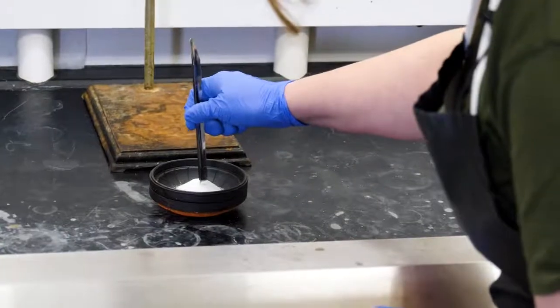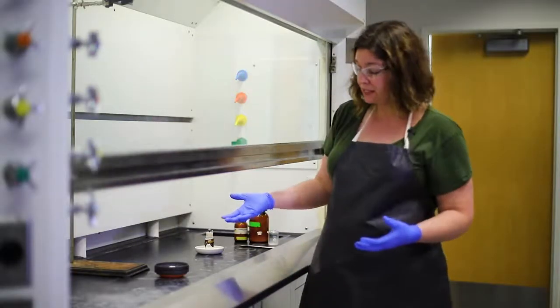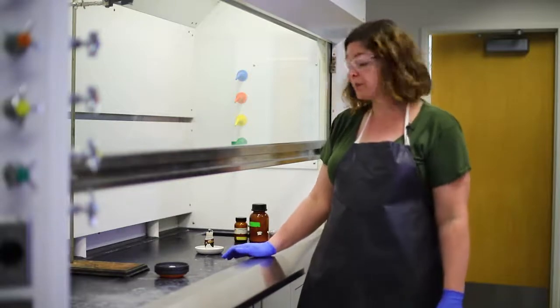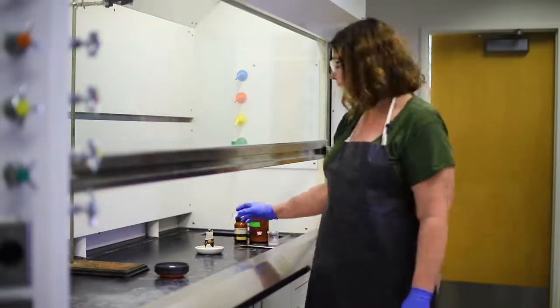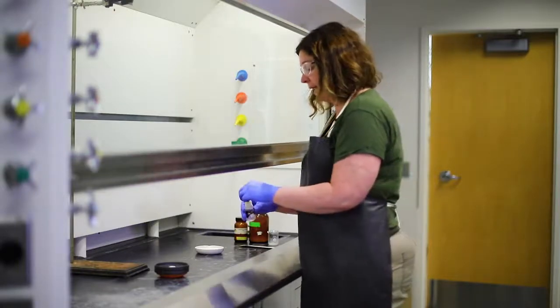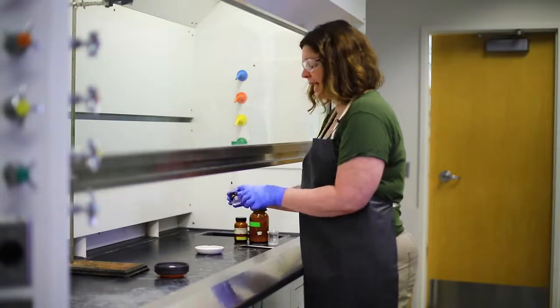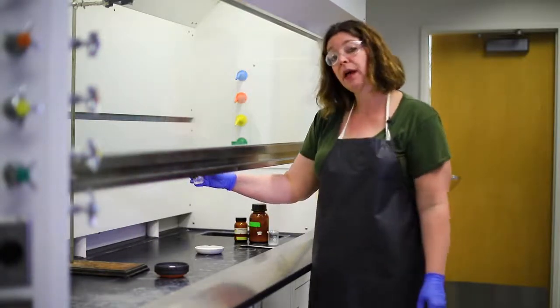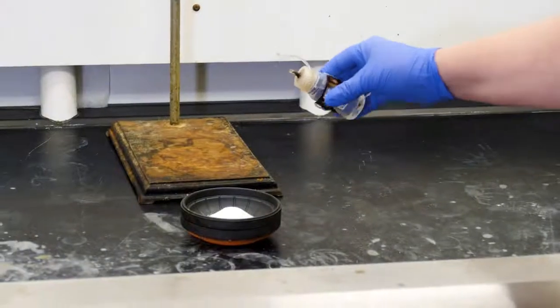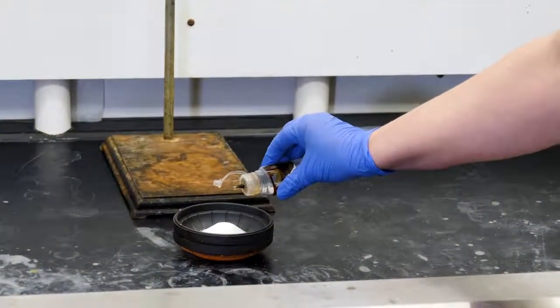So I've mixed an oxidizer and a fuel source together, and if we let these sit together long enough, they would react. But we're going to be a little impatient, and we're going to add a couple drops of acid, which will act as a catalyst for this reaction. Again, I'm using an acid, so I need to make sure I'm wearing gloves. I'm going to put a couple drops of acid in the back, right here in the center, and then I'm going to step to the side.